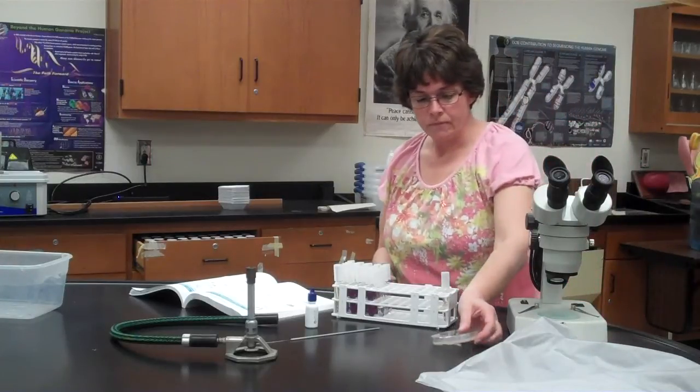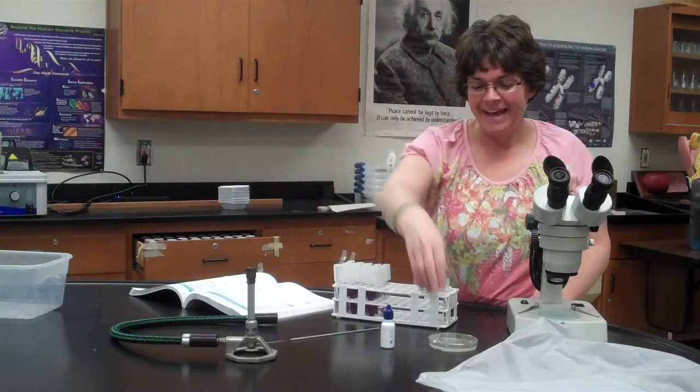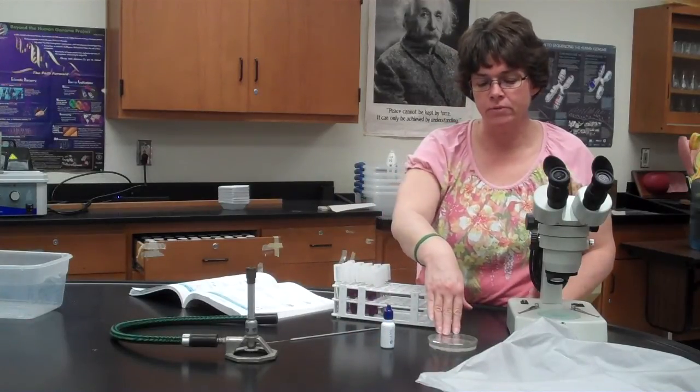The next part is going to be the actual microscopic view with your compound microscope. So it's the same as we did with the yeast. You're going to use the lactophenol cotton blue, and you're going to make a wet mount of the mold. Now what you want to be careful with is try to take it as gently as possible off the top. However, some of these molds, when those hyphae get digging into the agar, it gets really hard to pull them off. So in some cases you almost have to take a chunk of it to get it to work.